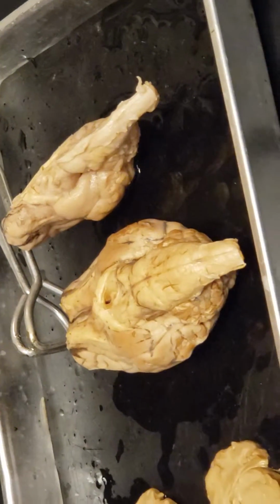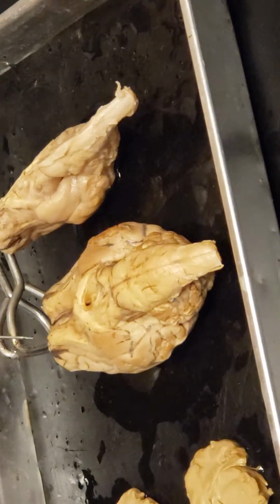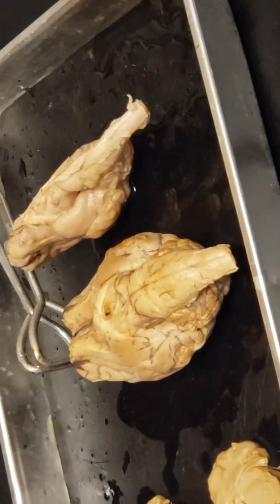So which part is the actual optic nerve? I'm sorry. So the optic nerve would be the part that comes outside of the cranial case, outside of the skull, because that's a nerve, which means we're in the peripheral nervous system. Okay.